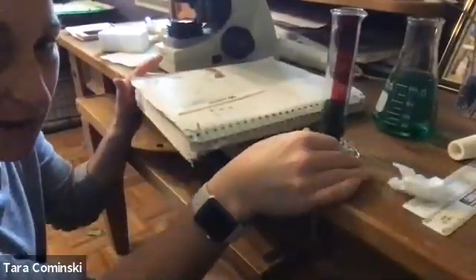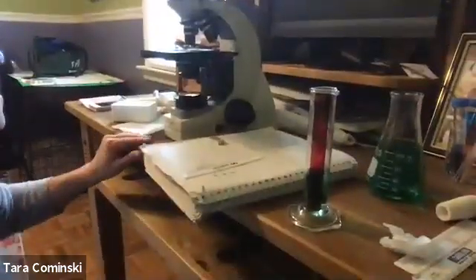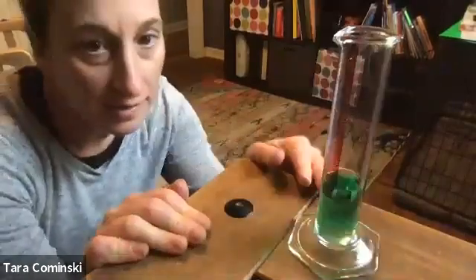Now, again, it is kind of a little bit hard to see. I did use green water to make it a little bit easier, but I think maybe I need more light. So let's move over here. Maybe that's what the problem is. I'm just gonna move us. All right. Yeah, I think that helps. Okay, so if we look here, right? I think that helps a little bit.